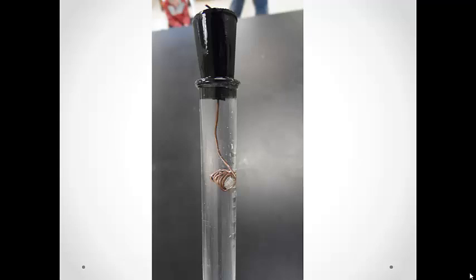Cap the end of your gas measuring tube with your stopper. You do not want any air bubbles anywhere inside your tube. You will probably have a little bit of water overflow at the very top, but that's okay.